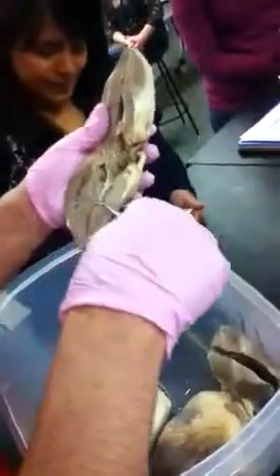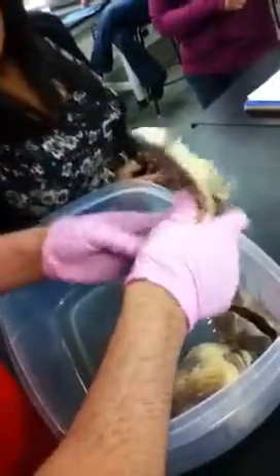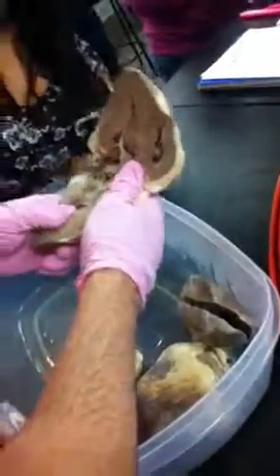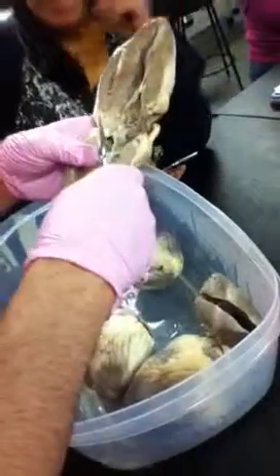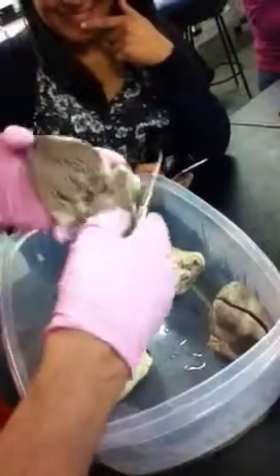Yeah, so papillary muscles we didn't really see. They would be these little muscles down here at the bottom. What the chordae tendineae is attaching to would be a papillary muscle. Would that be more like a picture? It's probably more like a picture, or you're not going to see it. One of the two.